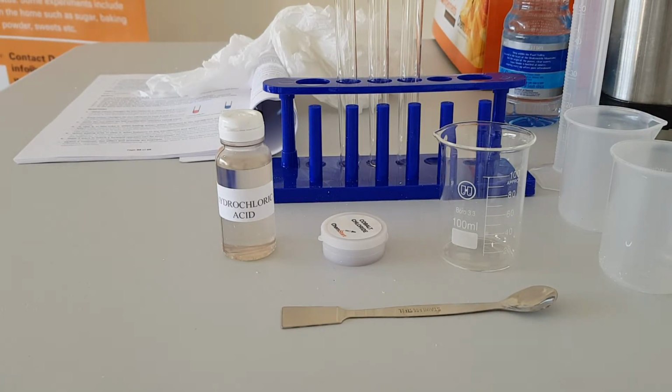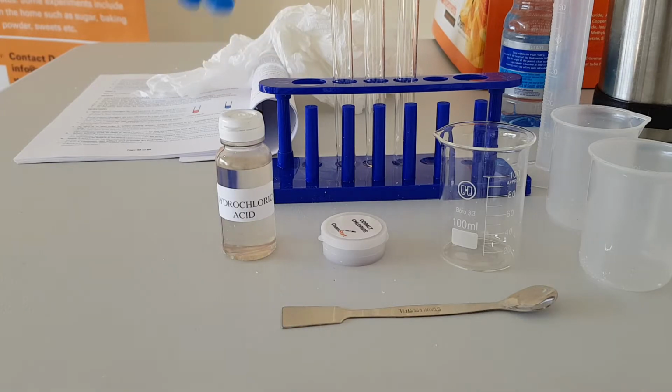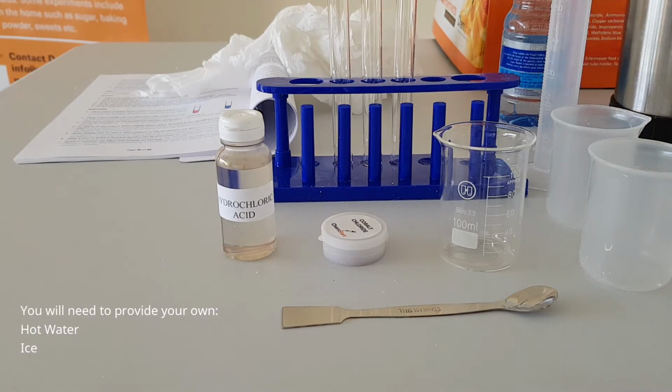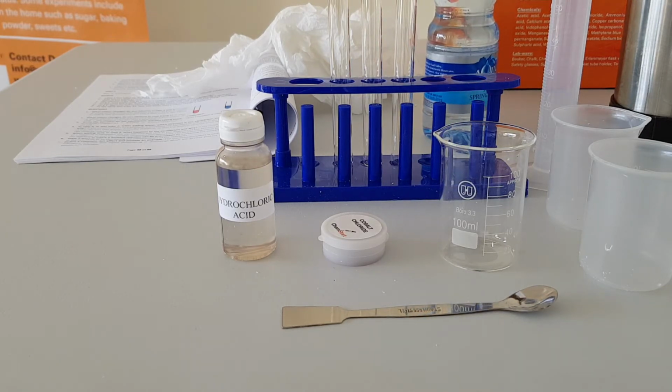So the experiment we're going to look at first is the effect of changing the concentration of the products and the reactants on cobalt chloride solution. Now these are the items that came supplied with your science kit. So you will have the test tube rack, the test tubes, the chemicals. What you will need to provide is the ice. I put hot water in this flask, and you must also provide the water that you're going to need during the experiment.